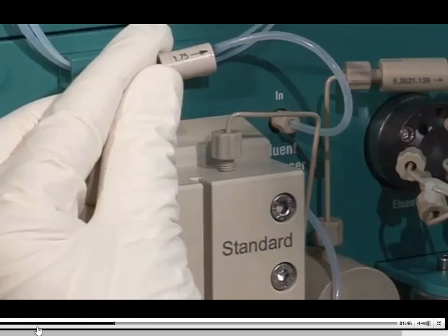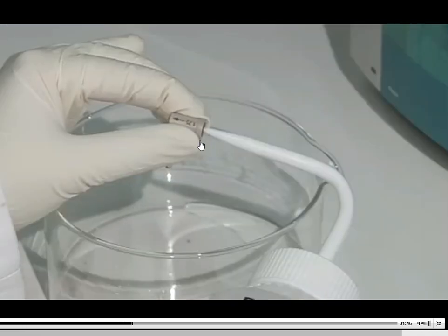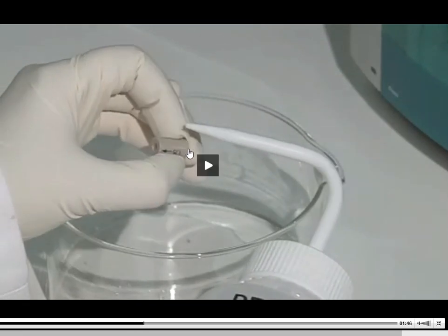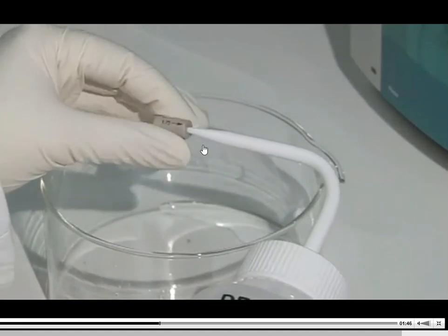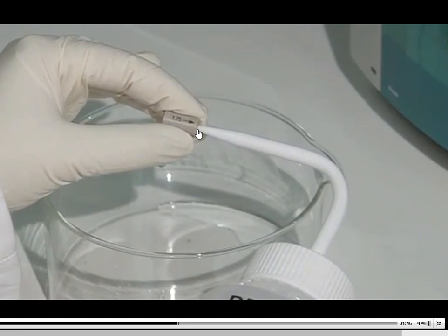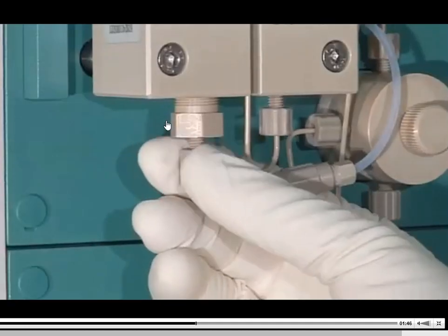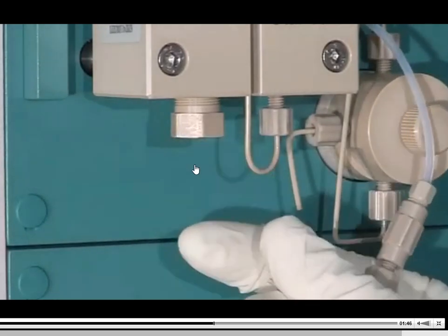So what you're going to see them do is take this piece that has a small little membrane filter on the inside of it, and they're just squirting water in one direction. This will only flow in one direction, and that's what you're seeing with the arrow here. If they flip this thing back around, one way will not allow flow of liquid, and you're going to see them back flush it. As they squirted it through the front end, though, the liquid went through without a problem, and that's a very good sign that it's staying clean.